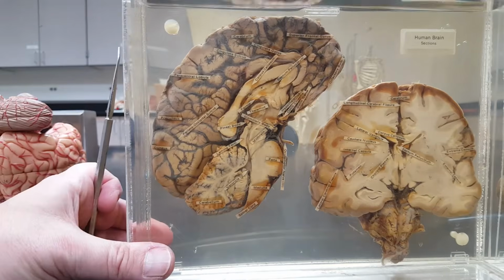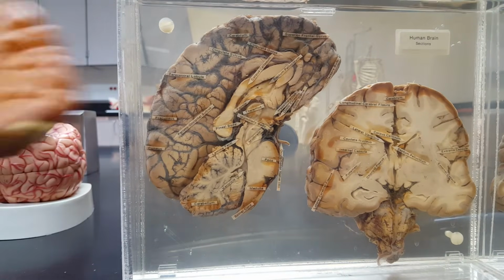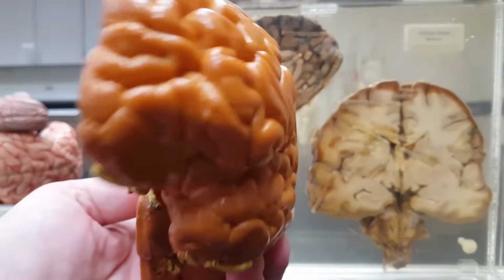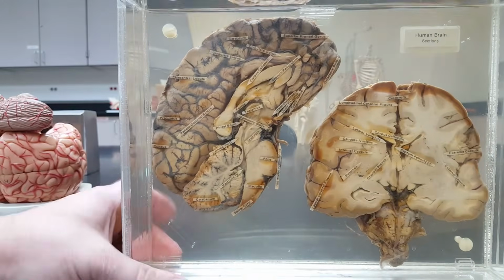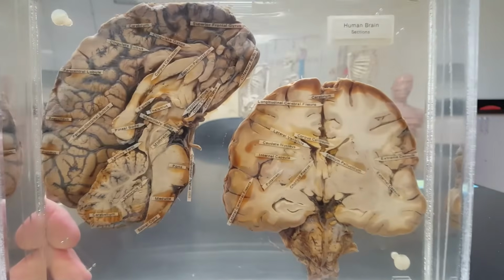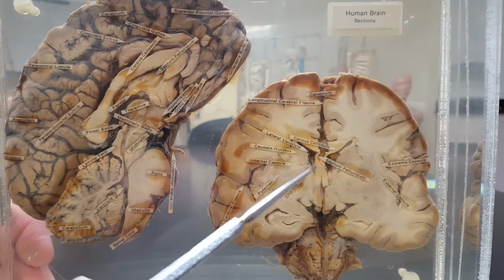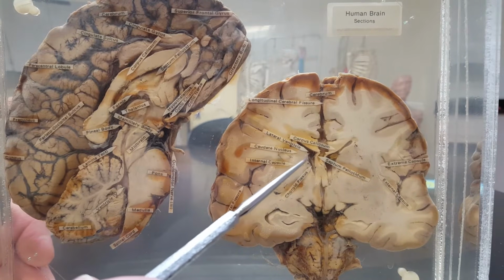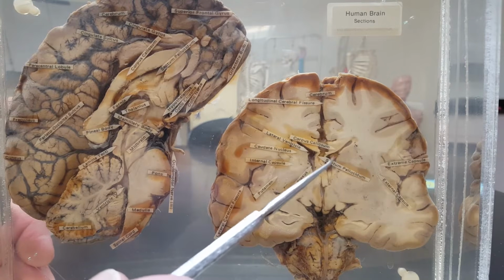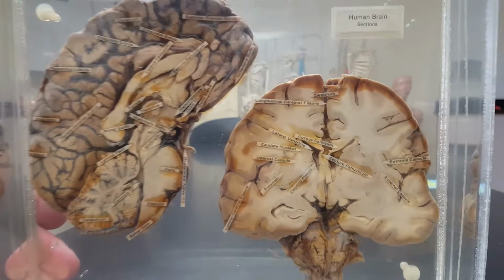And if I look at this frontal section, so I want you to imagine this brain right here, if I cut it this way, so you were looking straight on into it, do you notice the hollow spots? Right here and right here, where we would see and find cerebrospinal fluid. There's 2 of them right there. There are 4 altogether.